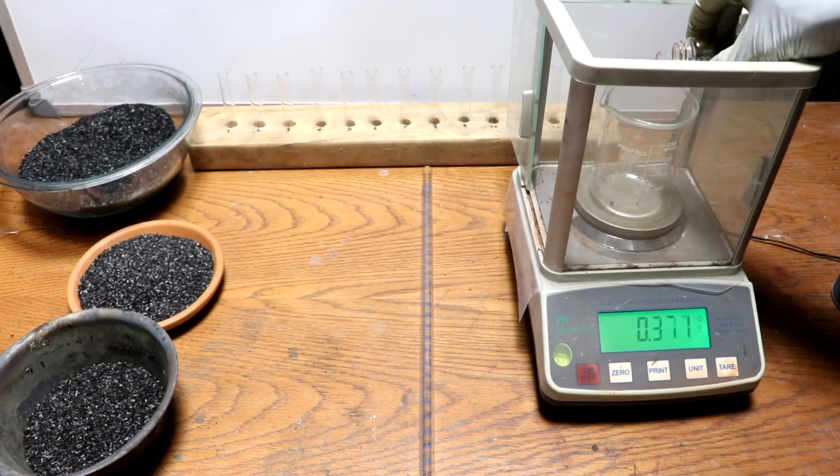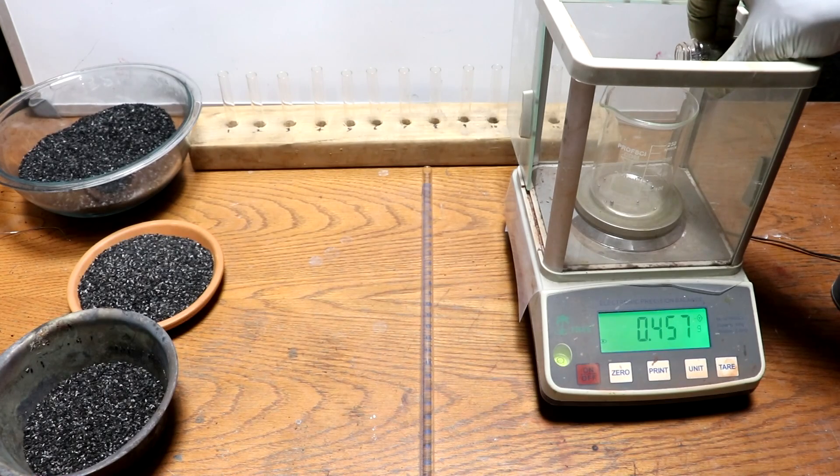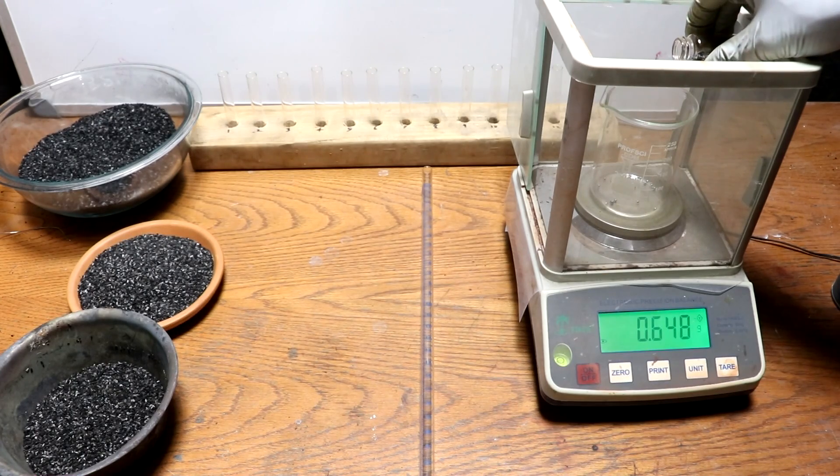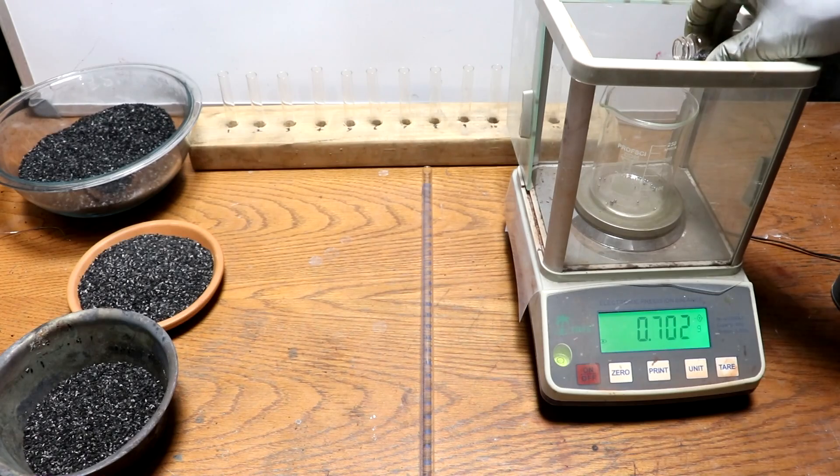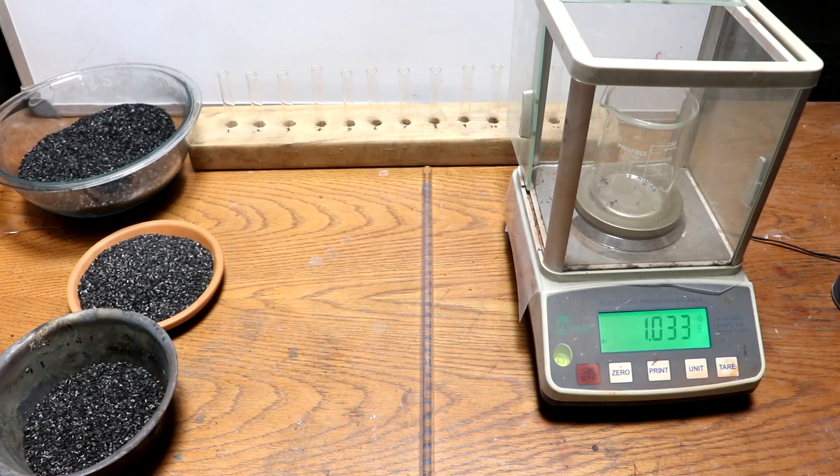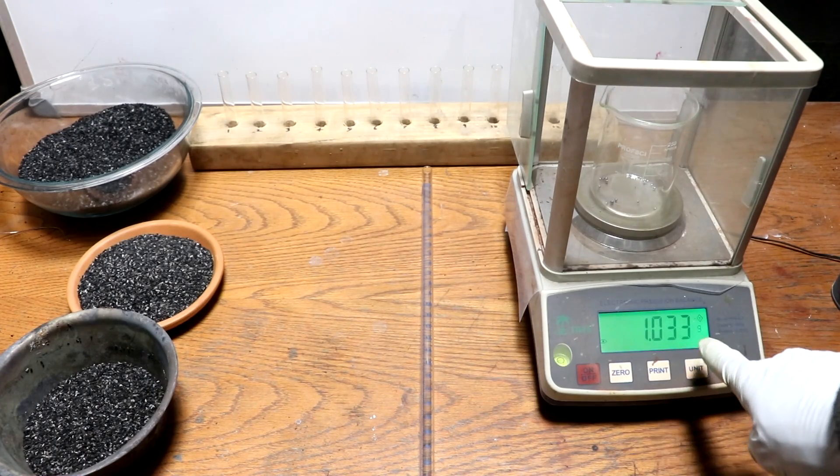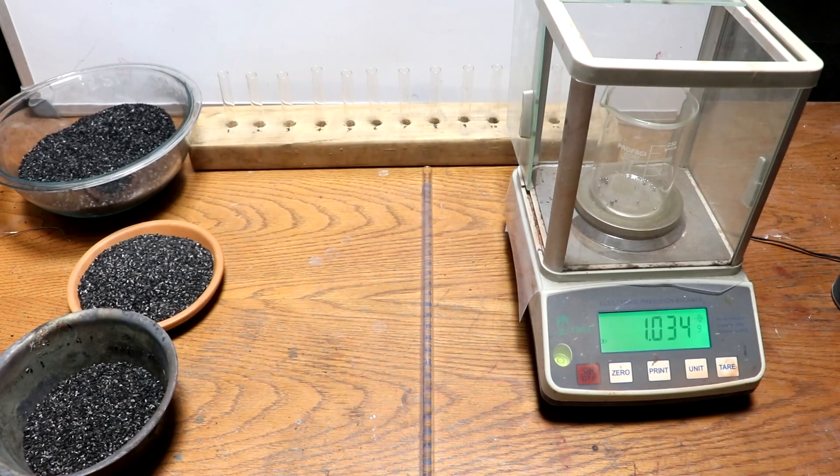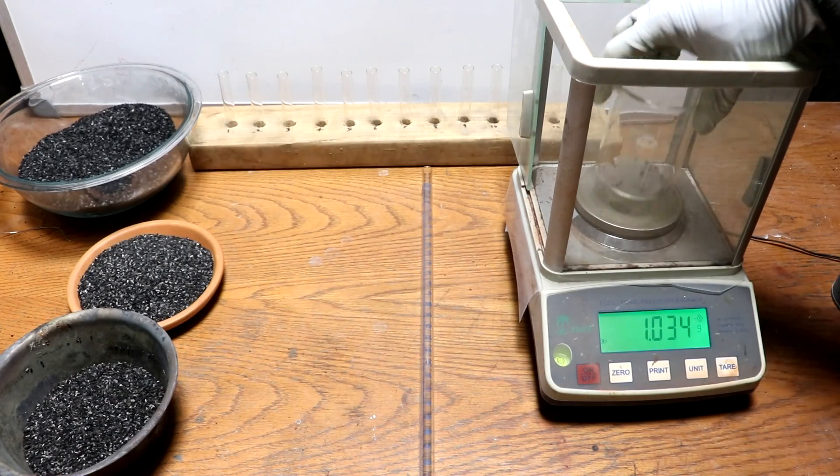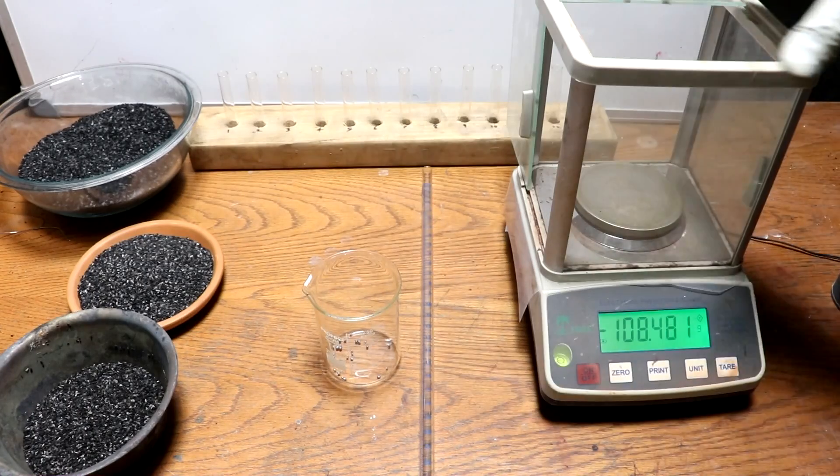Iodine is pretty dense so this actually isn't quite that much. And of course I am just kind of getting rough numbers here. Like that extra few milligrams there I'm not going to worry too much about. So there's my gram of iodine.